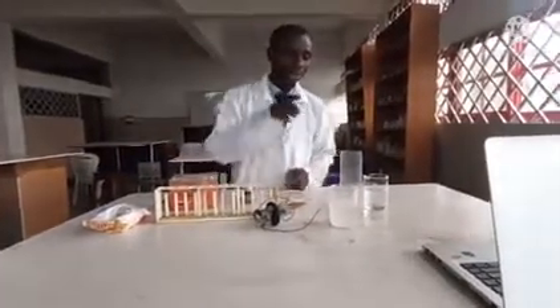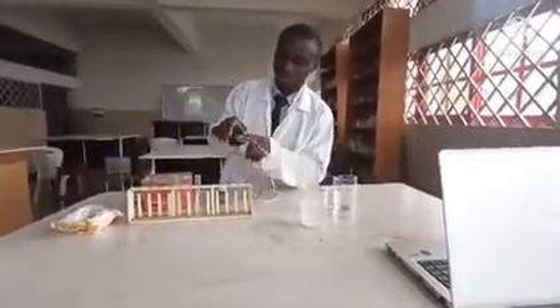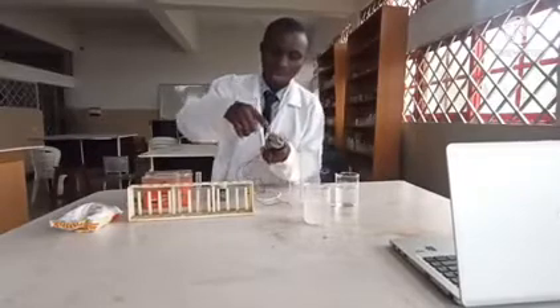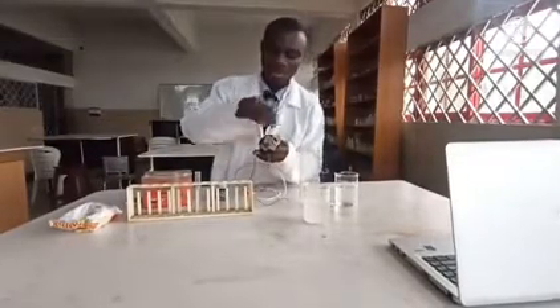What I'm going to do is make my electrolytic cell. For my cell I have this set of syringes — 20 mils — these are the given sets, the wire and the construction with the electrodes inside. There is also a cloth here to separate the compartments.